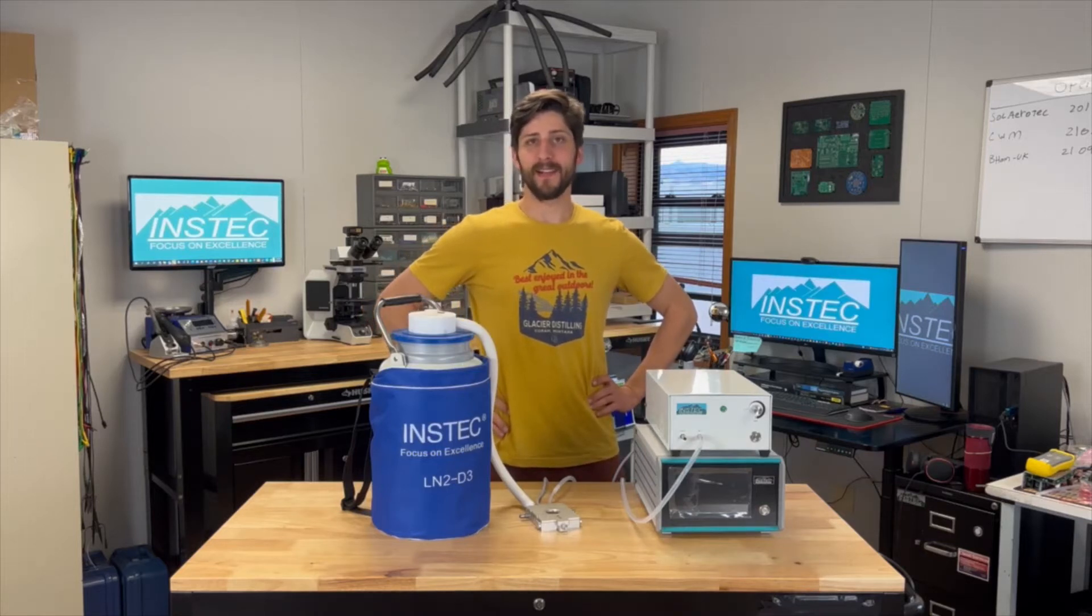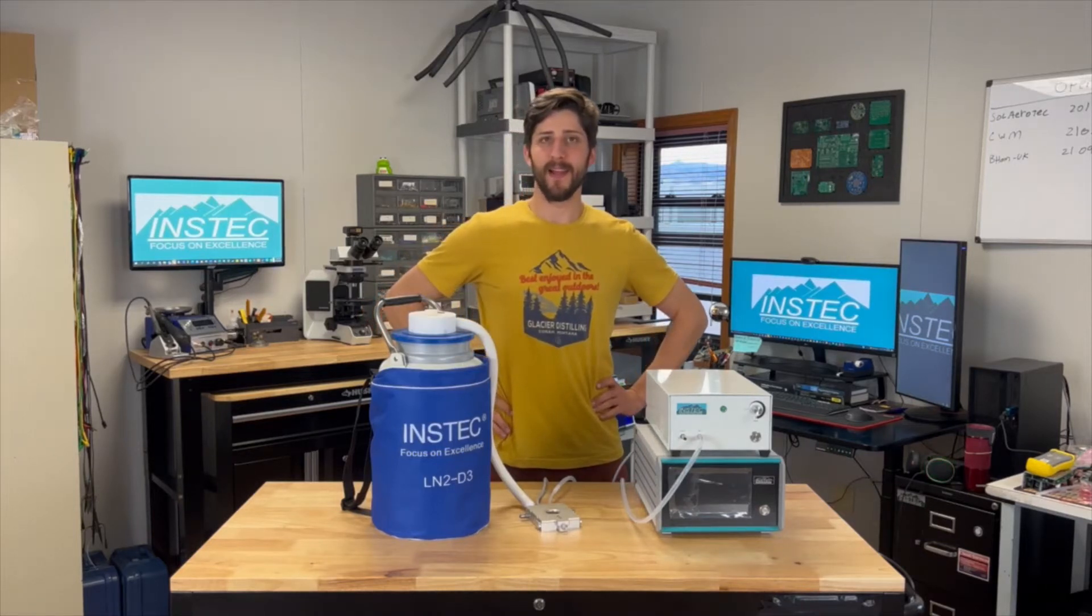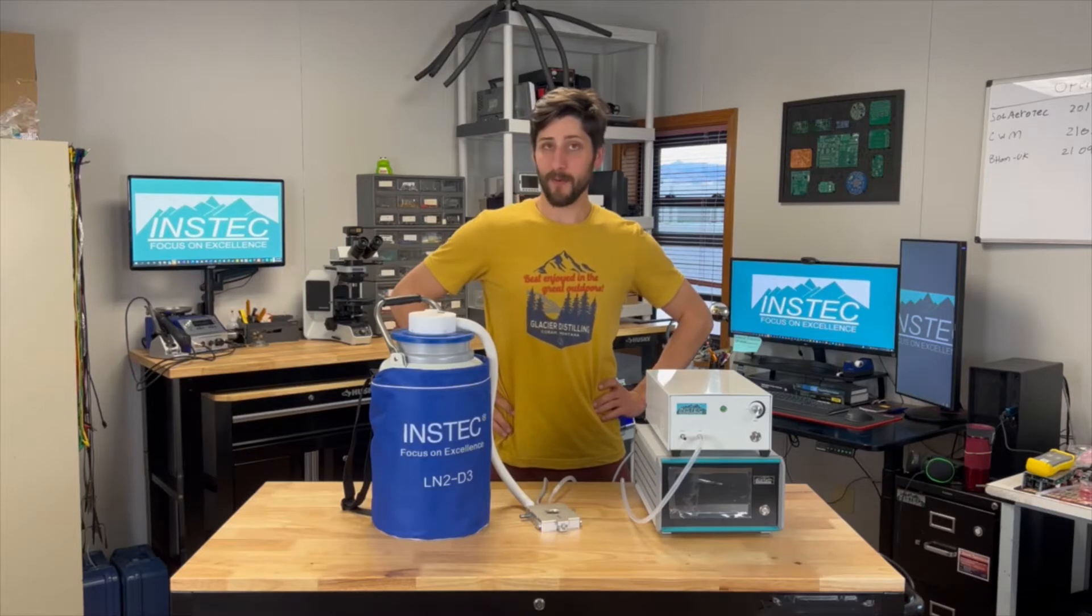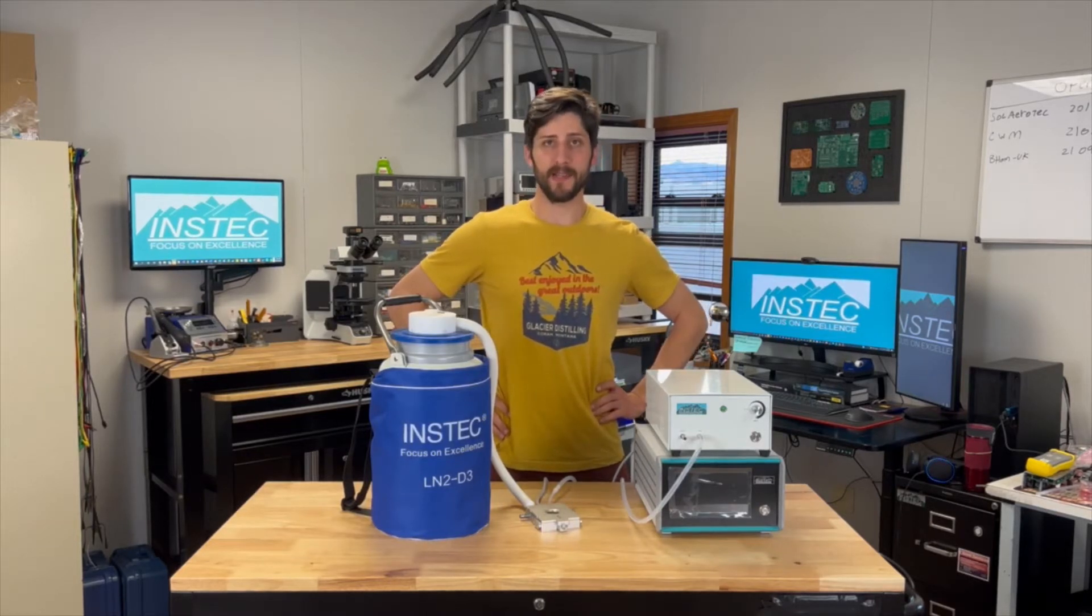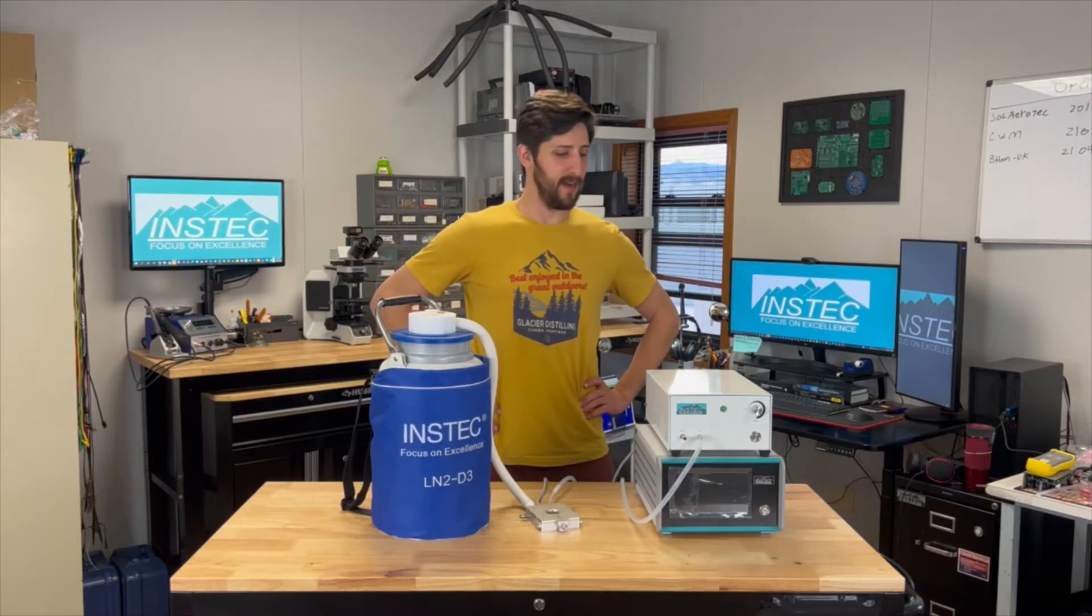Hello and welcome to the INSTEC liquid nitrogen setup tutorial. Today we're going to be looking at the INSTEC liquid nitrogen system, how it's connected, and the key operational components.